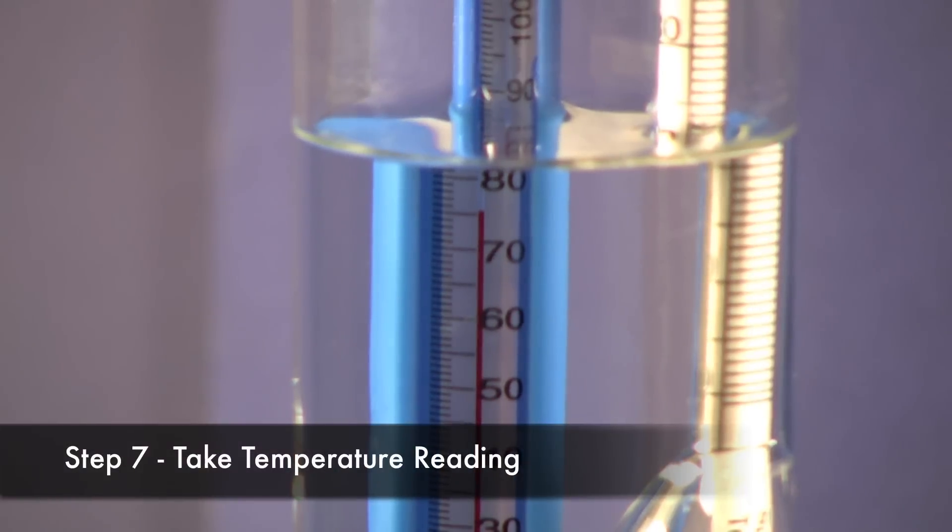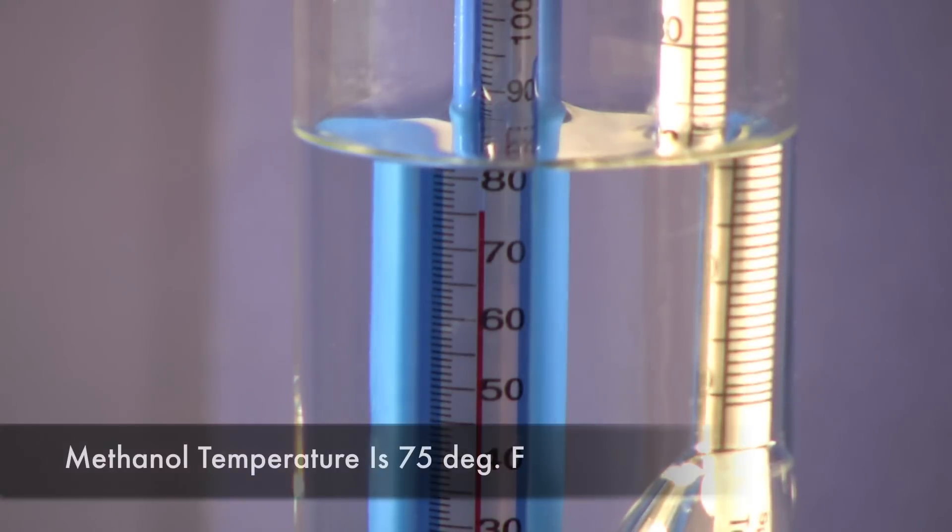We've let this sit for a while, and we're sitting right at about 75 degrees Fahrenheit. So that's the number that we'll use.